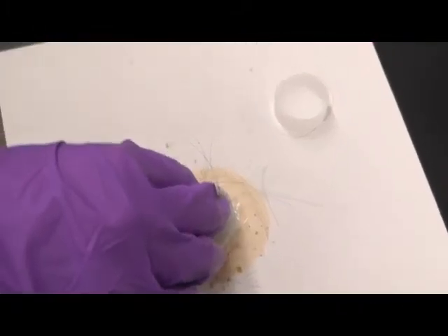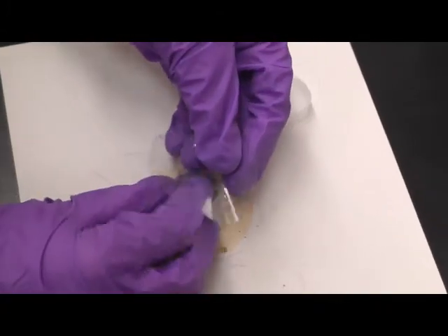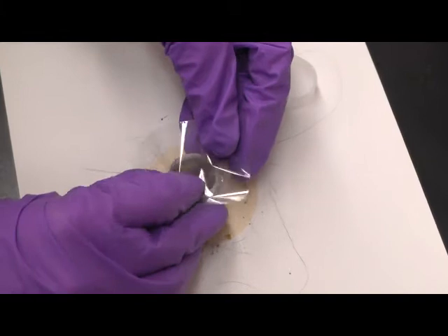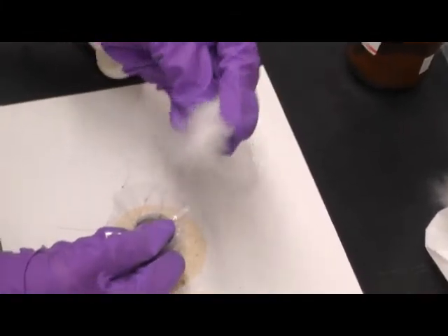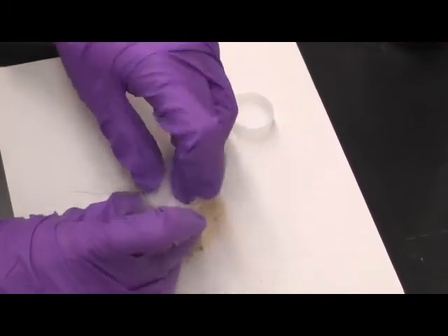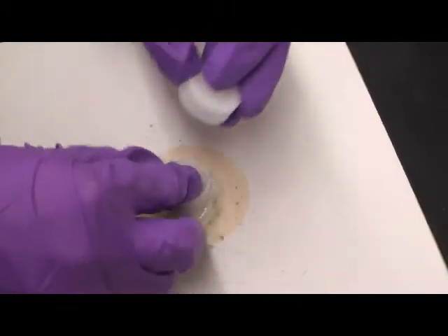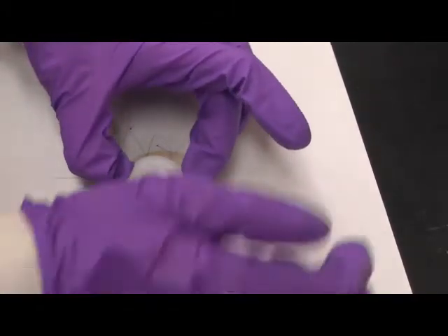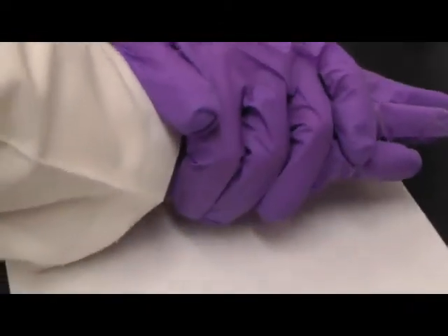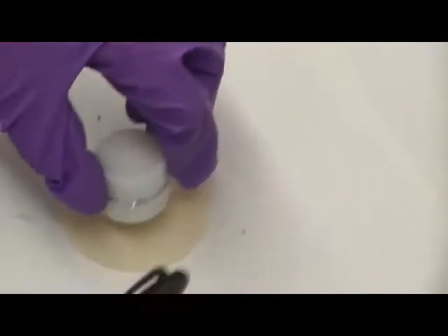Then we put on a second thin film. And again, fill the rest of the top space with stuffing.